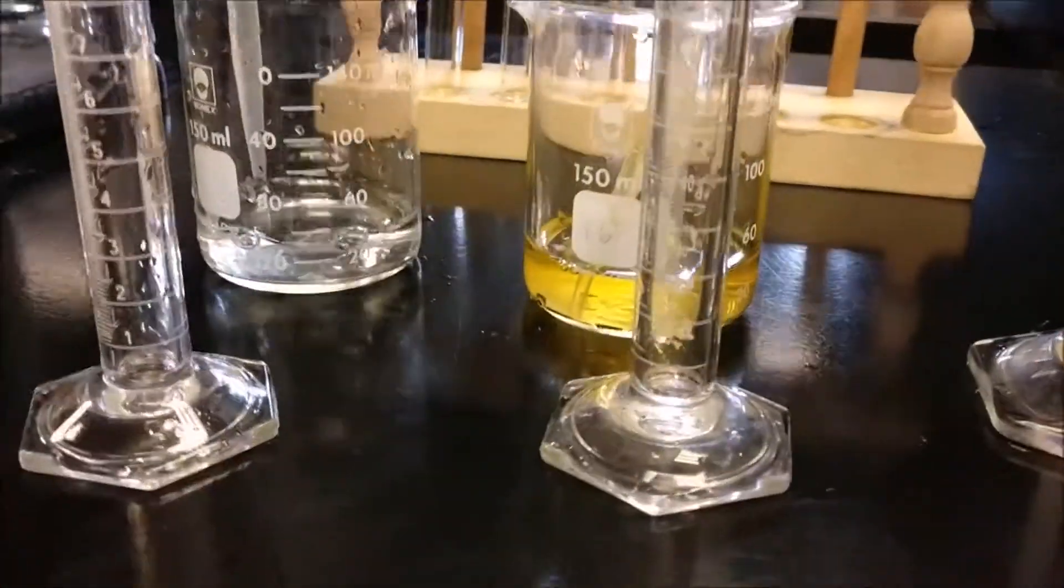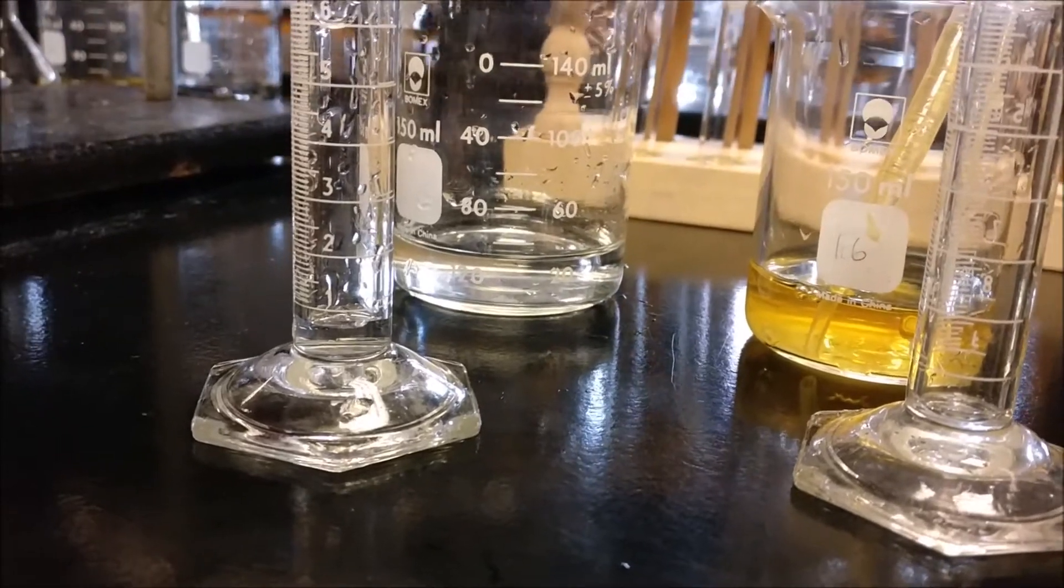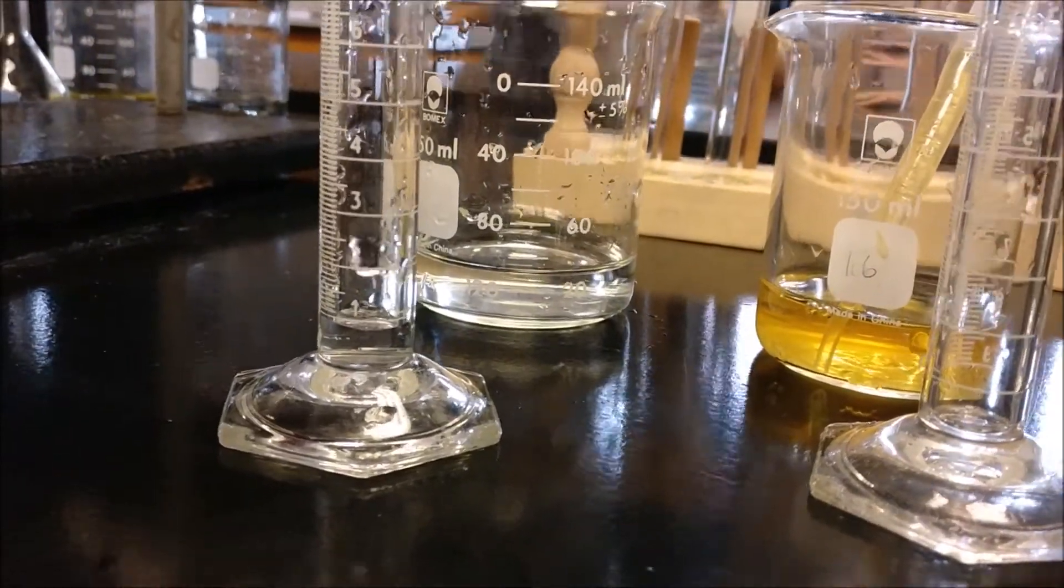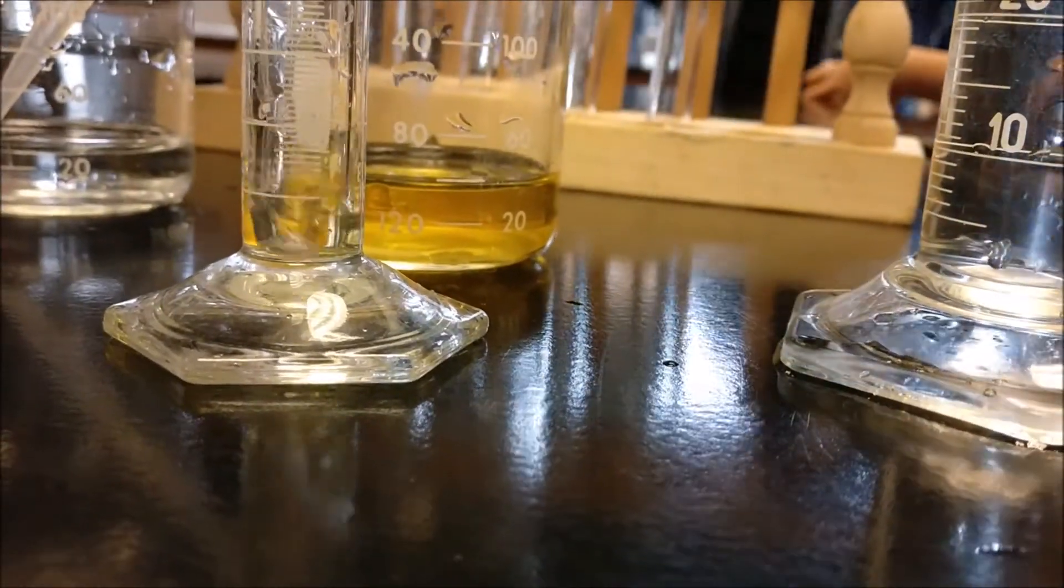In order to prepare the solution for trial 1, measure out 1 ml of the sodium thiocyanate solution and 1 ml of iron-3-chloride solution.